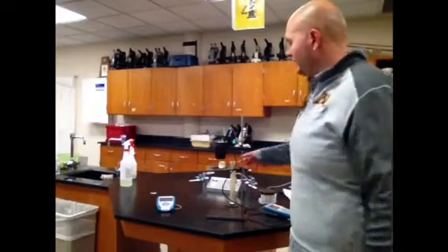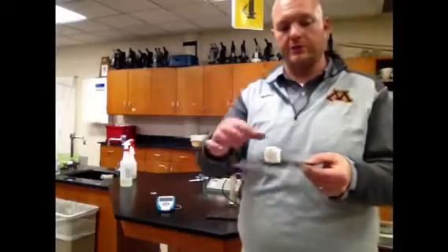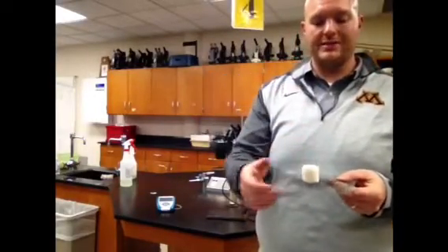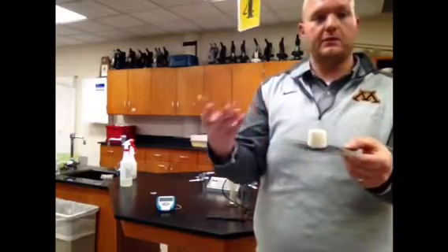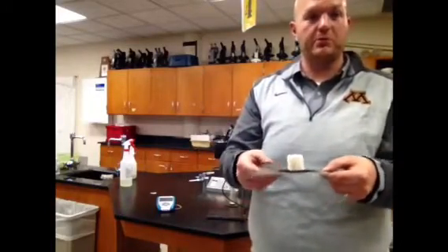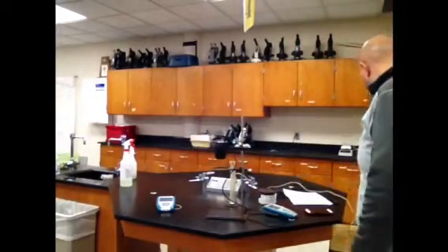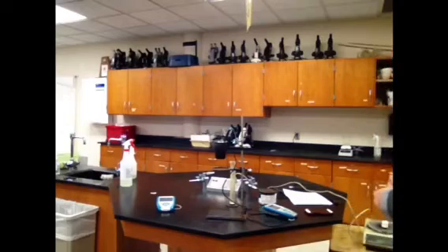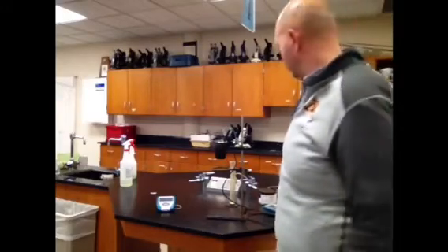We're going to skip the one that says final temperature of water. That'll be done when we are done with the actual lab. But we have to look at the mass of the food plus the holder. The reason why you need the mass of the food plus the holder is because when you burn just this, it's most likely going to stick to this wire mesh. So if we know the mass of the food plus the holder, we can measure it both times because we don't have to scrape it all off this wire stuff. So let's put it on the balance. Mass of food plus holder says 20.18 grams.